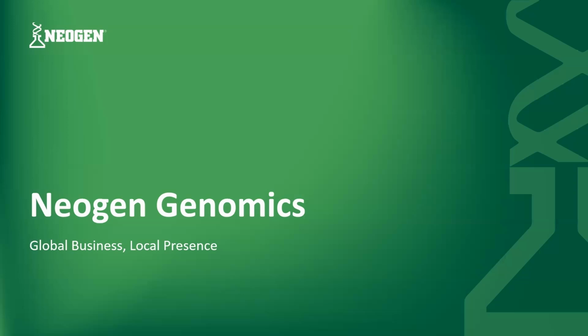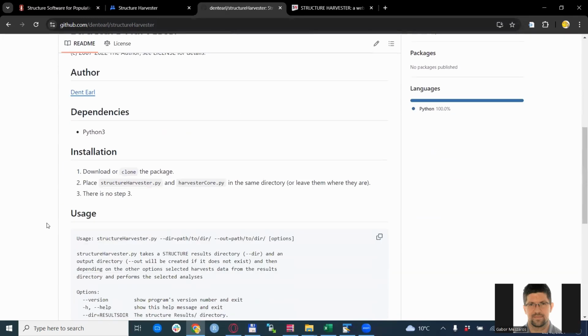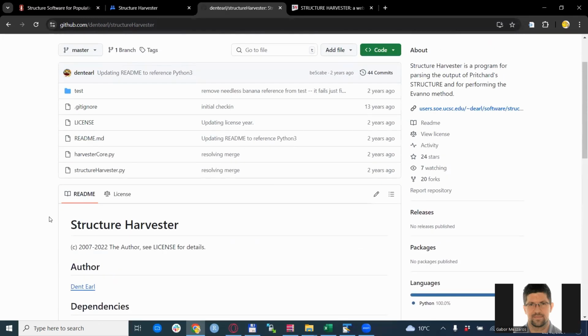And now back to Structure Harvester. The Python scripts for Structure Harvester can be downloaded from GitHub. You just go to the GitHub page of the author and to the Structure Harvester page, where you can find the actual scripts and some description of how to use it. But we will just demonstrate the use of it, especially with the Evanno method, in this video.